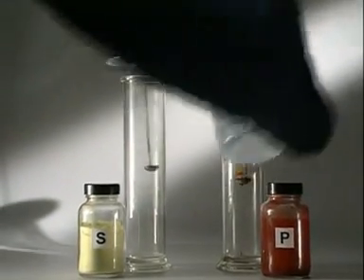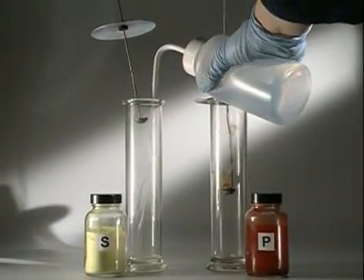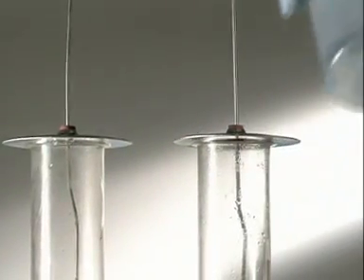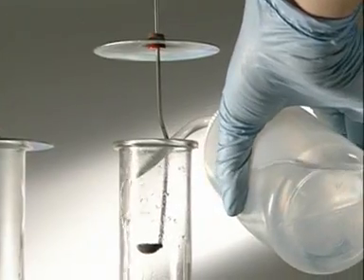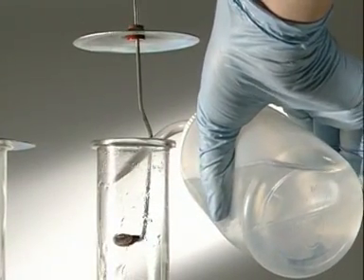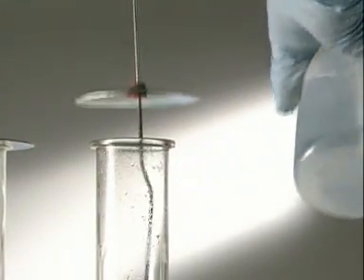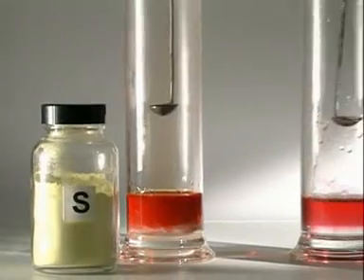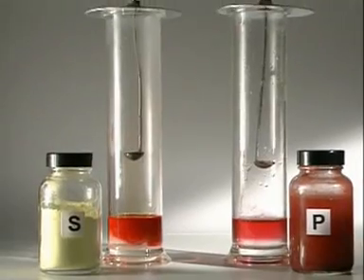Adding water dissolves the oxides. Sulfur dioxide is a colourless gas. The white phosphorus 5 oxide has settled in the jar. A few drops of universal indicator test the pH. The solutions are both acidic.